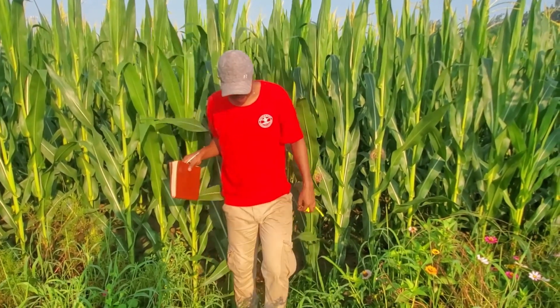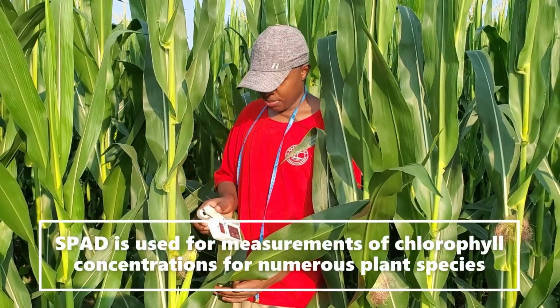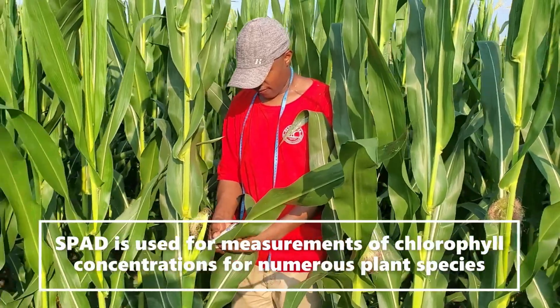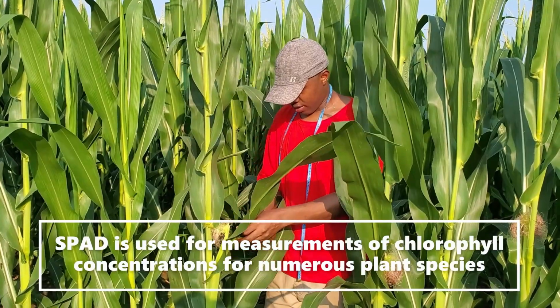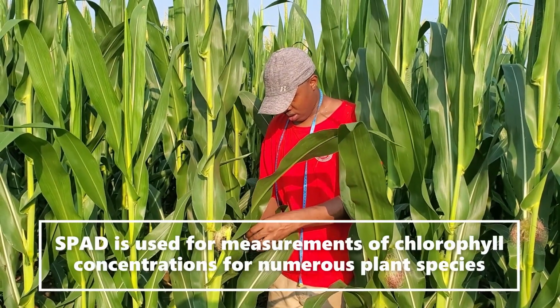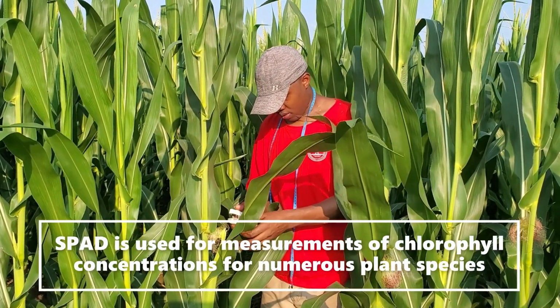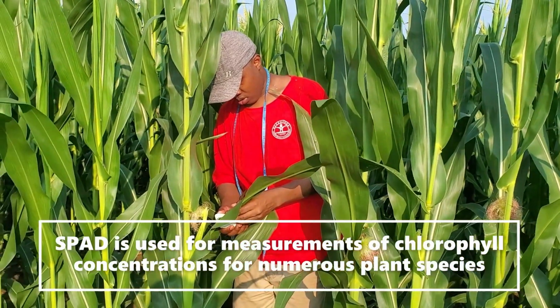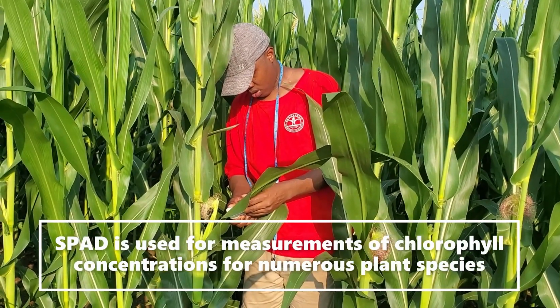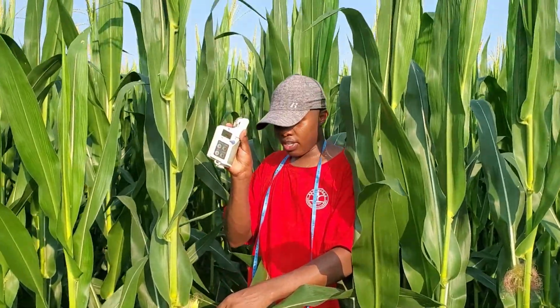And then I'm going to show you how to use SPAD. SPAD is an electronic instrument used for measurement of chlorophyll concentration for numerous plant species. So we use this to determine the amount of chlorophyll content in our leaf. In simple language, to determine the amount of nutrients. The higher the value you have, the higher the amount of nutrients in your plant. For instance, when you measure this maize, it shows that the value is very high.